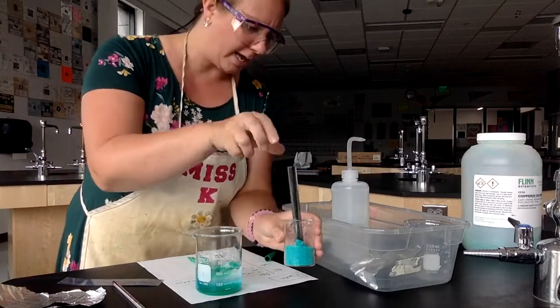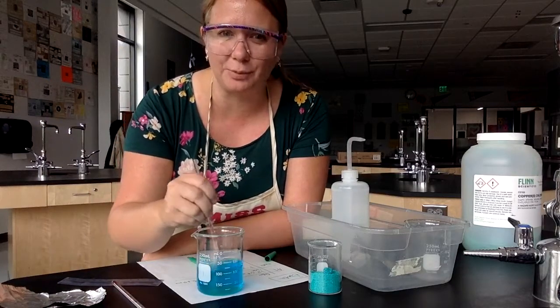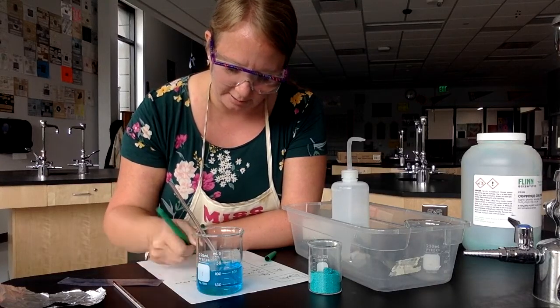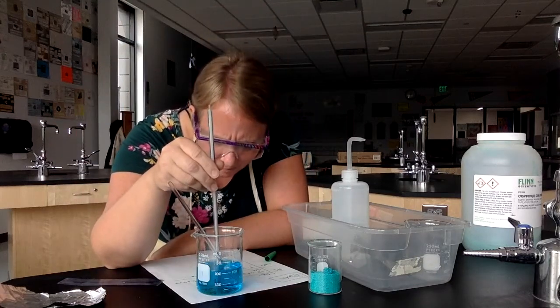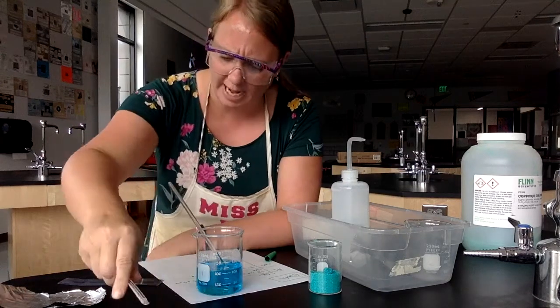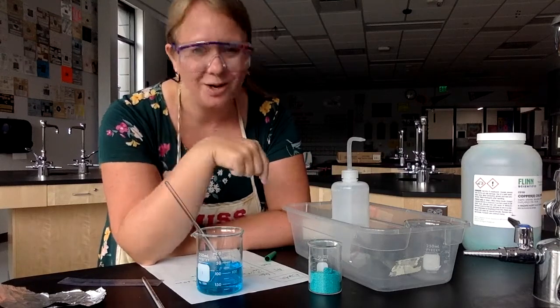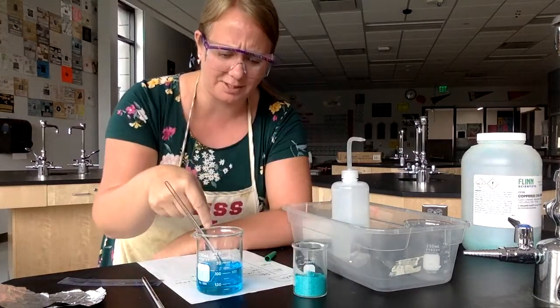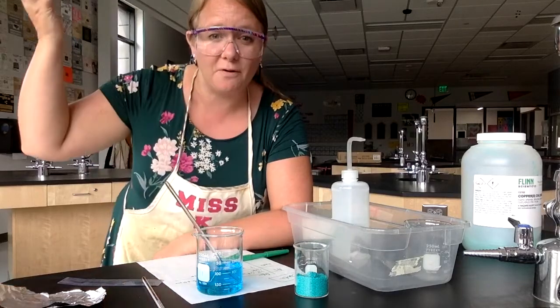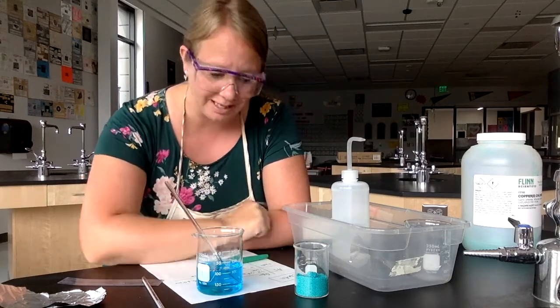I'm going to use my stir rod to mix that together. Notice it looks like a color change, but it's just because the greenish-blue particles are now spread out, so we get that blue color — blue water. Let's check for any temperature change. The temperature stayed the same when I added the copper(II) chloride, but we got a color change. Is this a sign of a chemical change? No, because these are greenish-blue crystals and now we have bluish-teal water — these particles just mixed with the water particles. If I evaporated the water, I'd still have the copper(II) chloride sitting behind.